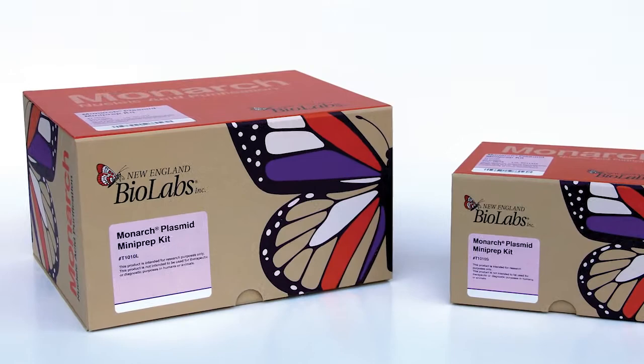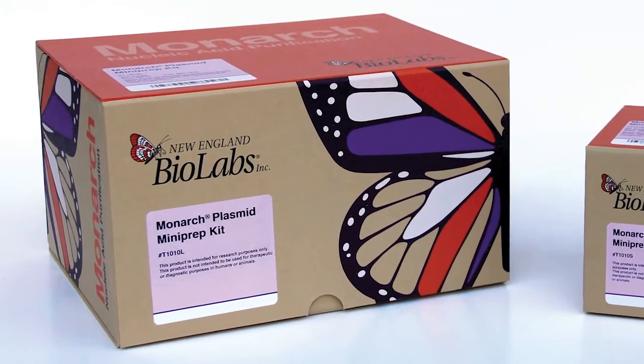Today in this short video, we're going to show you the basic steps that you need to follow to do a plasmid purification using our Monarch Plasmid miniprep kit.